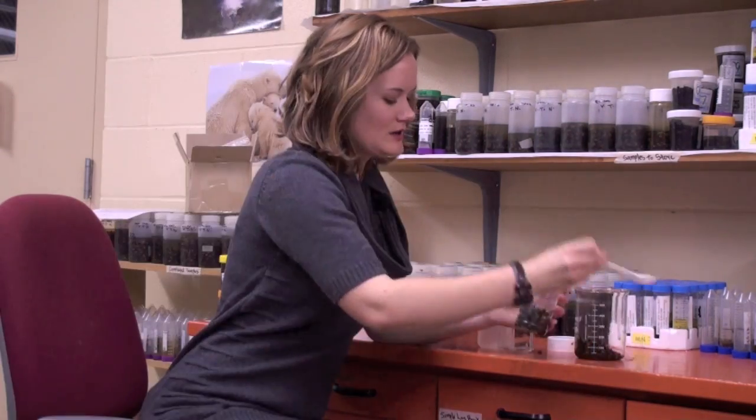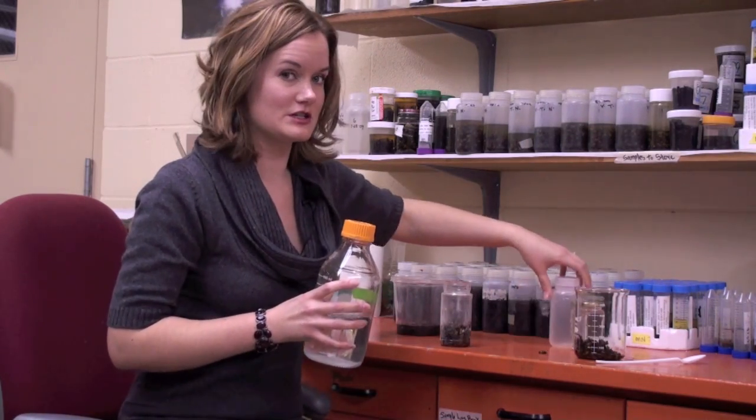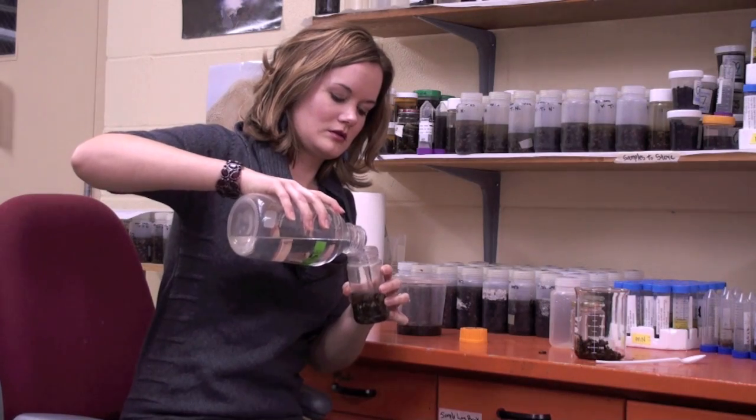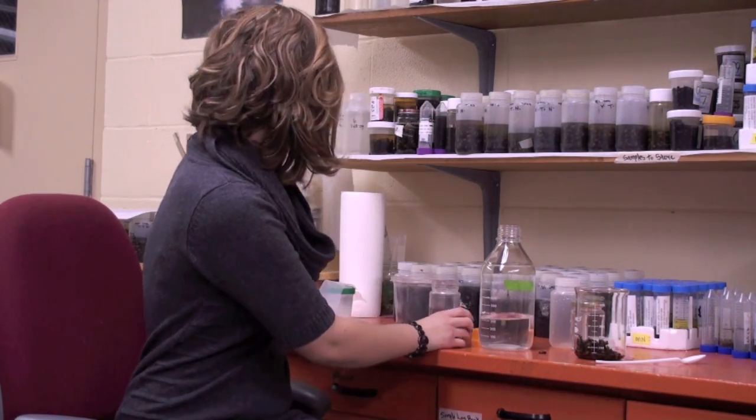When you go out and sample in the field and collect your bees, you're going to have dry dead bees and you'll be putting them into a container with alcohol. I need about half a cup to a cup of bees. If your colony is not doing well, I understand if you can't give me that many, but it's better for my analysis and more accurate data-wise if you can. So here's about half a cup to a cup of bees — what we're going to do is put alcohol inside and submerge the bees with it.